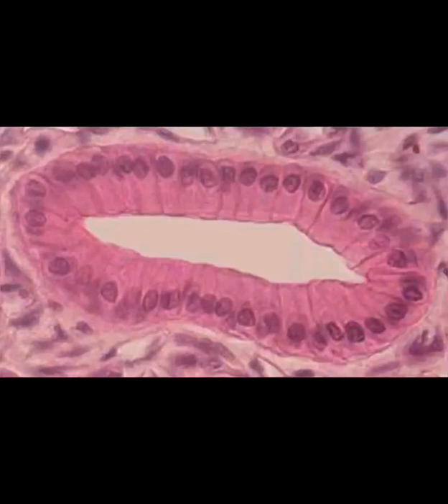So first off, what is epithelial tissue? Epithelial tissue is tissue that lines various body surfaces and cavities, and it will be resting on a basement membrane of connective tissue, and it will also have this harsh line that you can see, and either above or below that harsh line, depending on how you're looking at it, there will be empty space. That is one of the key things to look for when you're trying to identify if it is epithelial tissue or some other kind of tissue.